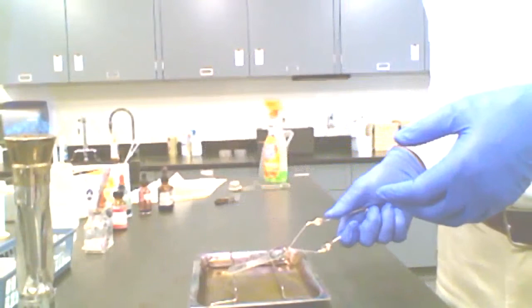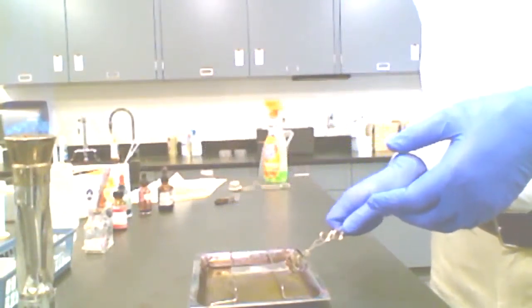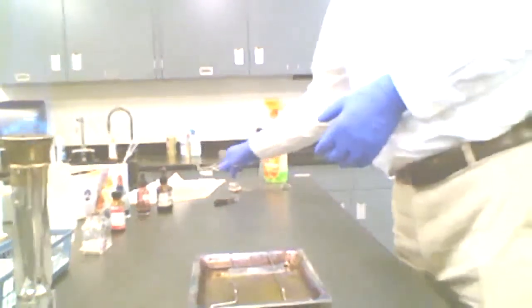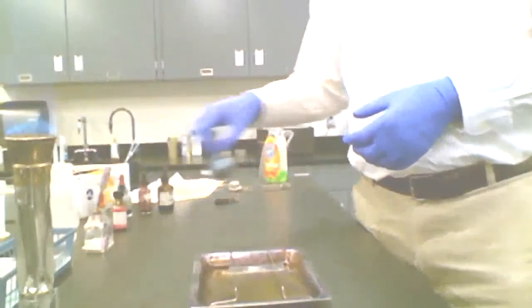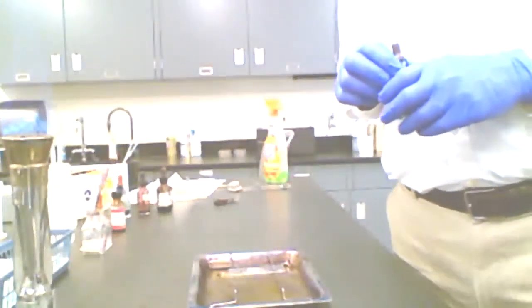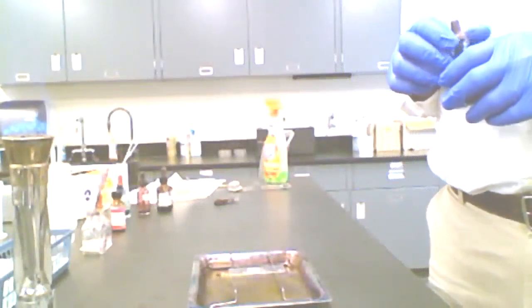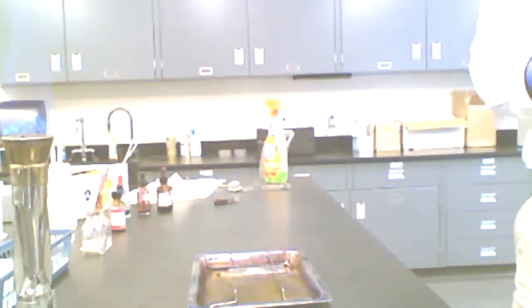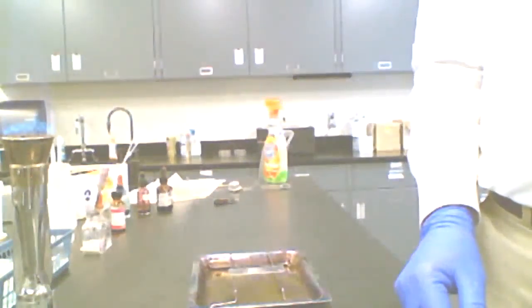This is a good time to quickly mention that heat fixation is typically used when we're trying to create what we would refer to as a permanent mount. If we want to view this slide multiple times, we're able to do that, compared to some techniques we'll talk about in the class where we discuss wet mounting, which won't result in permanent fixation. So, I'm done with my gas, so I'm going to go ahead and turn that off. All right, I don't need that.